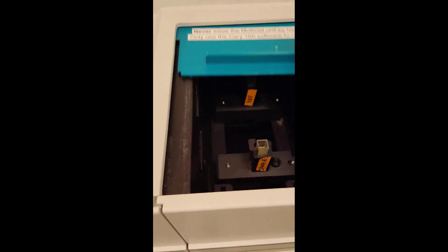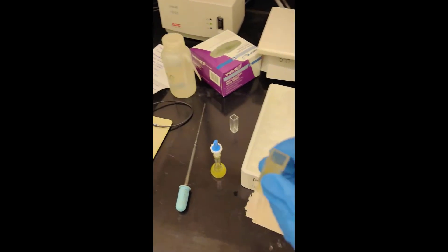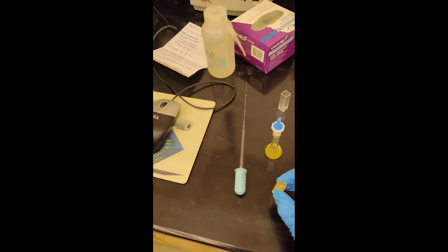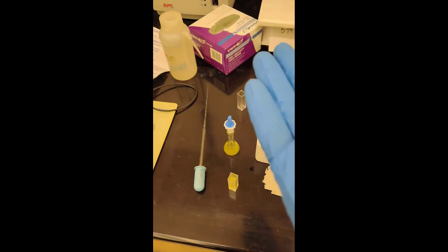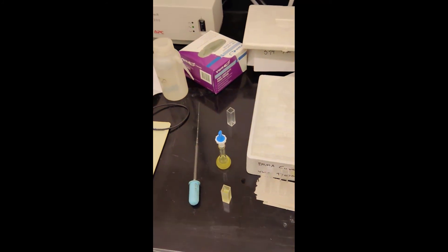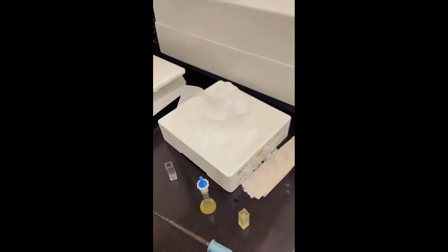You can empty out the first sample, dump it into my imaginary waste beaker, and then take a clean cuvette and load it with your next sample. But since I don't have another sample, I'm going to wrap things up here. Remove the blank from the reference compartment, and since the blank is just DI water, it's perfectly fine to dump down the sink. Let it dry out.